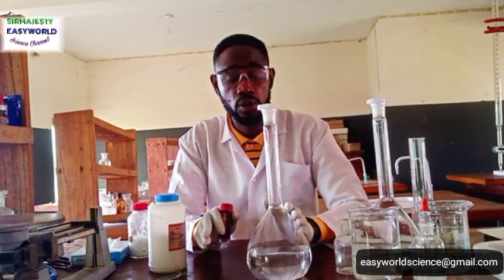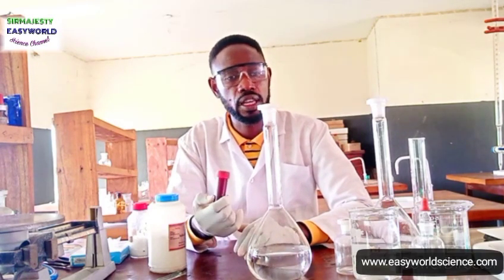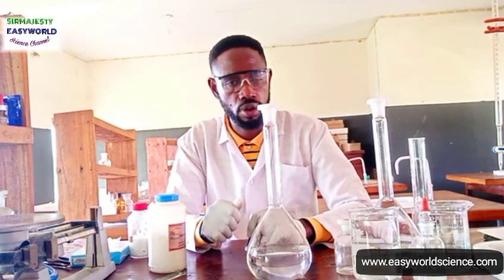From my analysis, from my experiment, it's obviously impossible for 6 grams of potassium iodide to dissolve completely 25.4 grams of iodine crystal. No, it cannot. And what must you do? You stir, and remember, this particular iodine is volatile, it sublimes. It is too unstable to the environment. So follow the instructions, don't correct them.